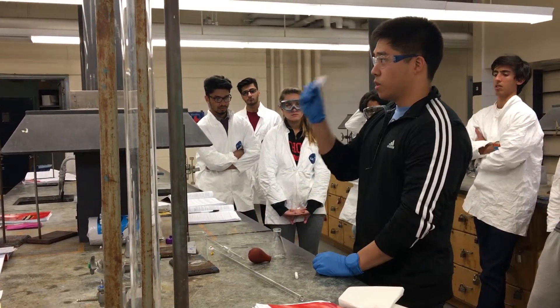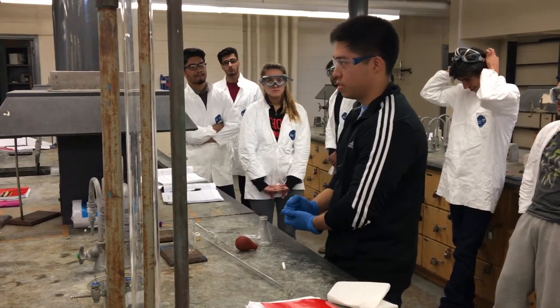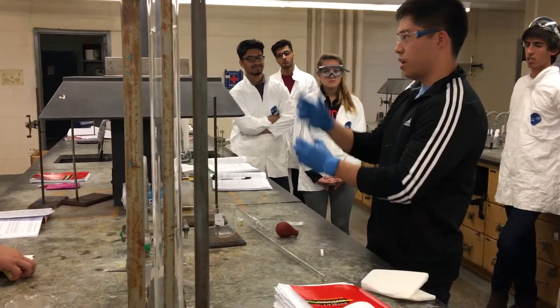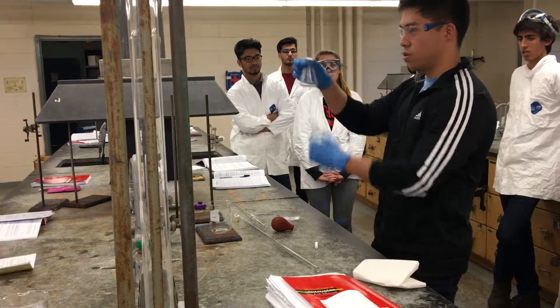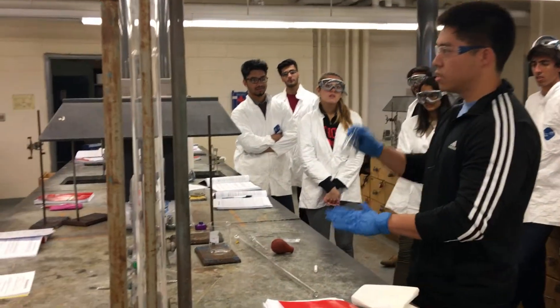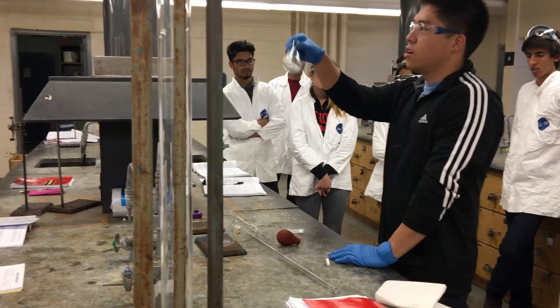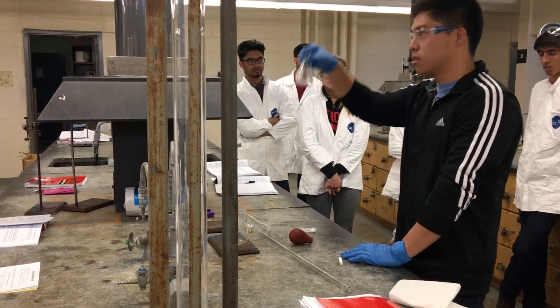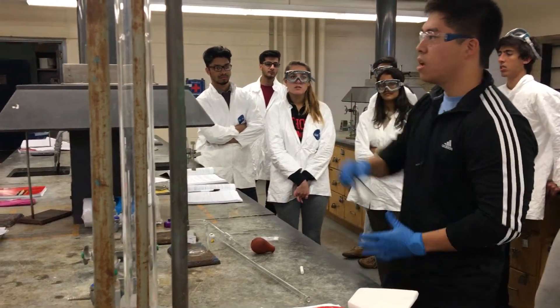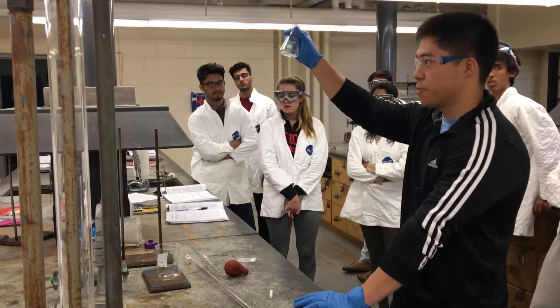After you measure the mass of one tablet, you can crush it to speed up the reaction — it becomes a fine powder. I do advise you measure the mass again after crushing. Then add the crushed tablet into your acid-water mixture and keep swirling. We're not boiling the solution — just add it to your Erlenmeyer flask and swirl for about two to three minutes until the fizzing stops. That fizzing is the carbon dioxide being produced. Once the fizzing comes to a complete halt, add 10 drops of the indicator bromothymol blue. The solution should turn yellow.